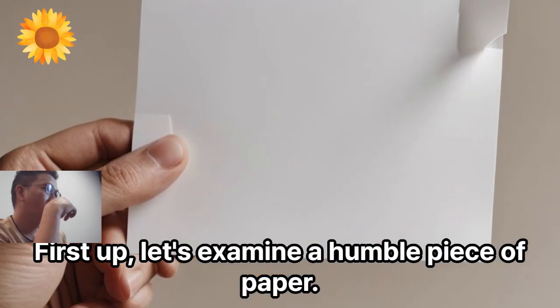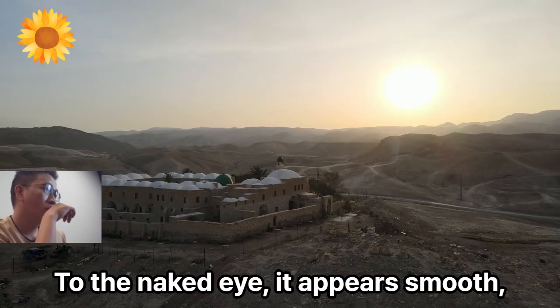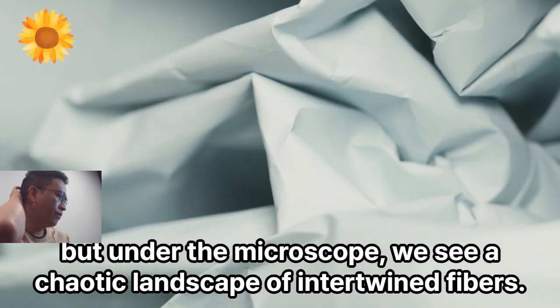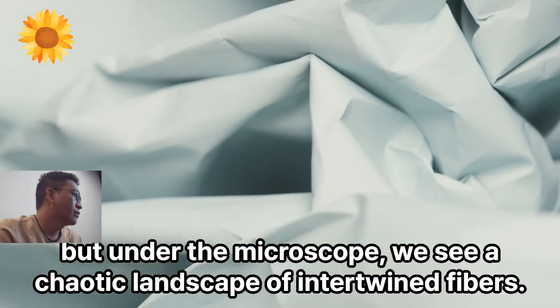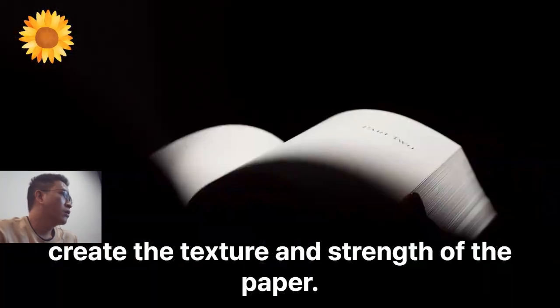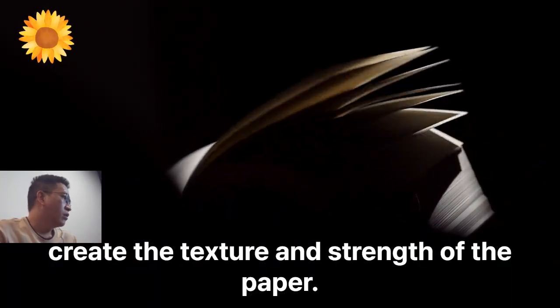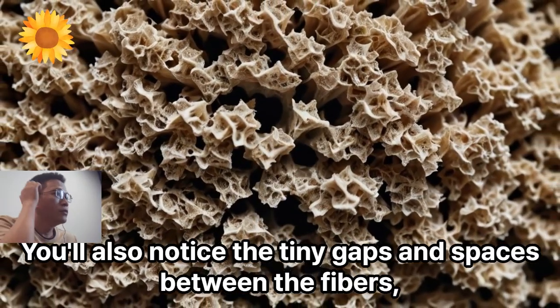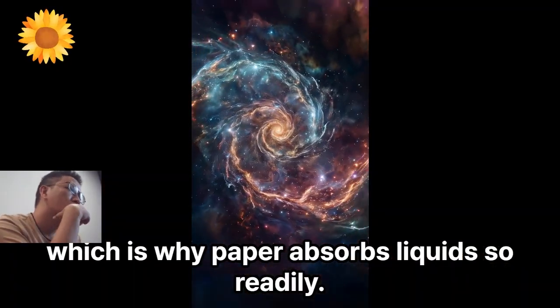First up, let's examine a humble piece of paper. To the naked eye, it appears smooth. But under the microscope, we see a chaotic landscape of intertwined fibers. These cellulose fibers, derived from wood pulp, create the texture and strength of the paper. You'll also notice the tiny gaps and spaces between the fibers, which is why paper absorbs liquid so readily.